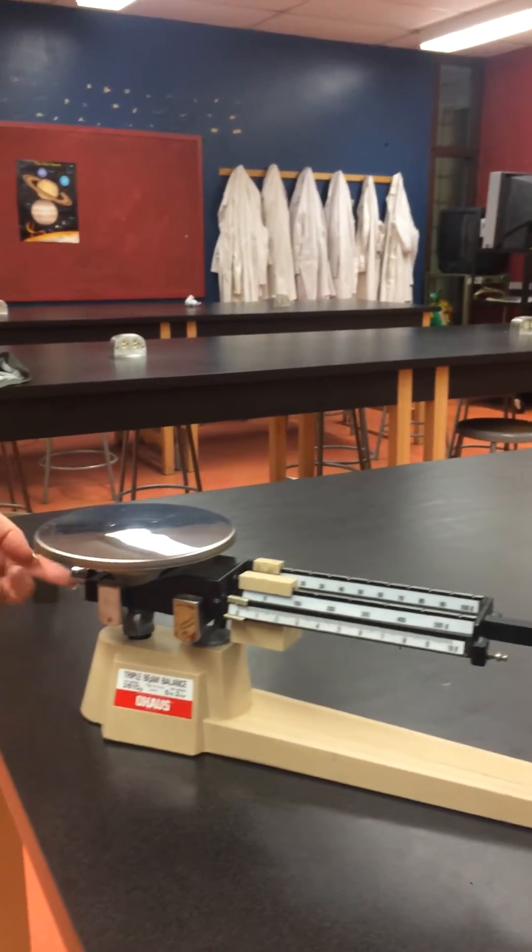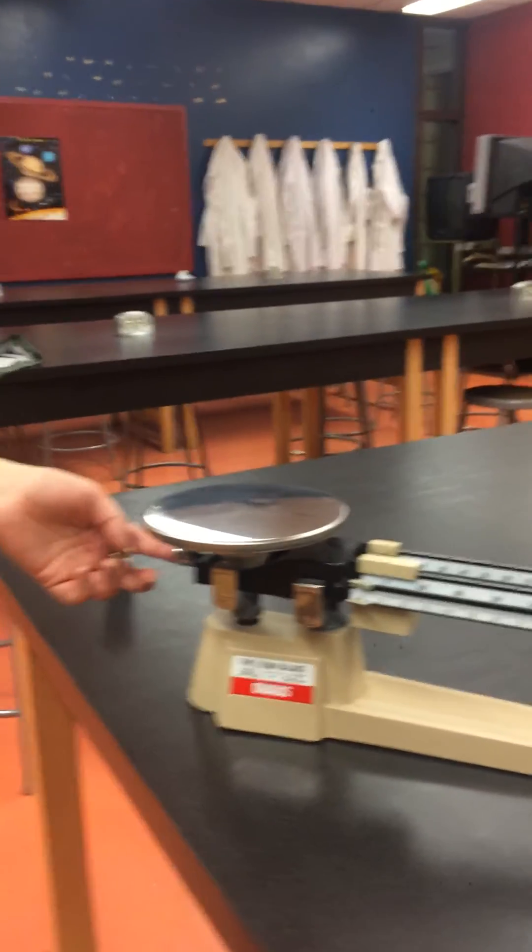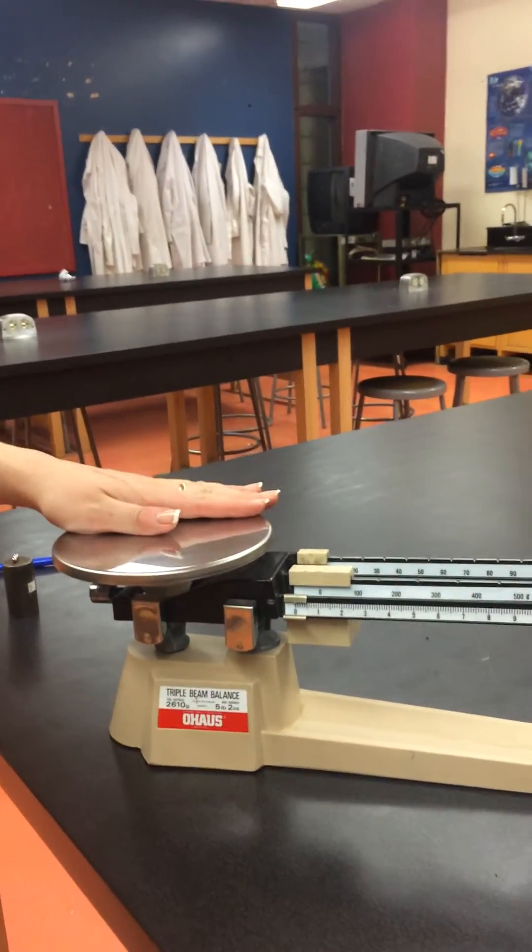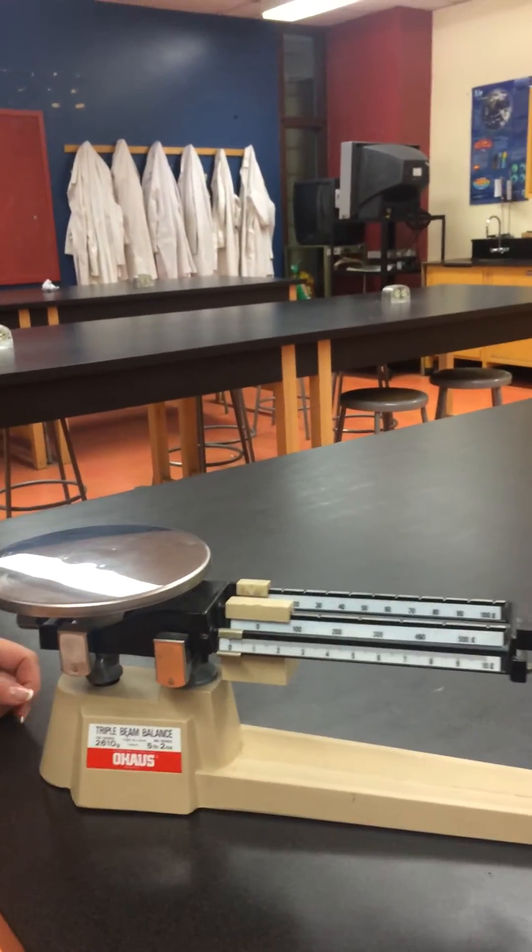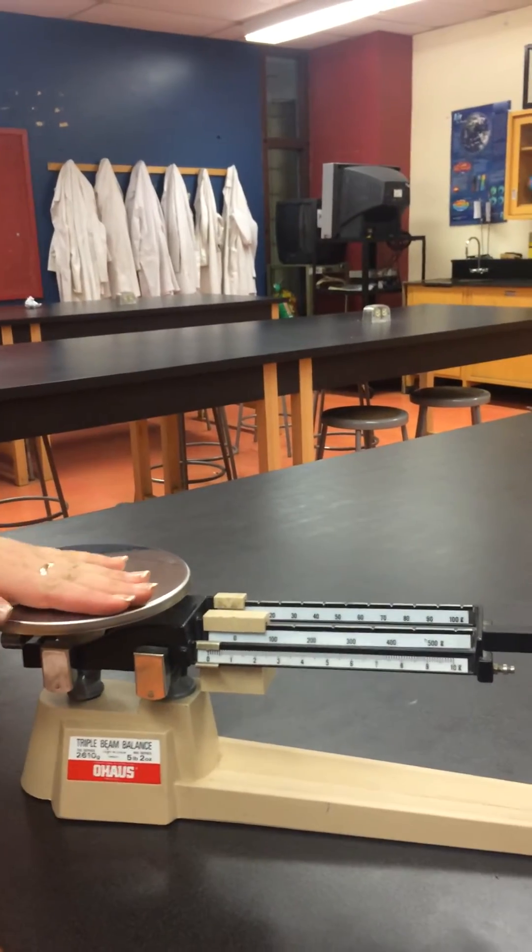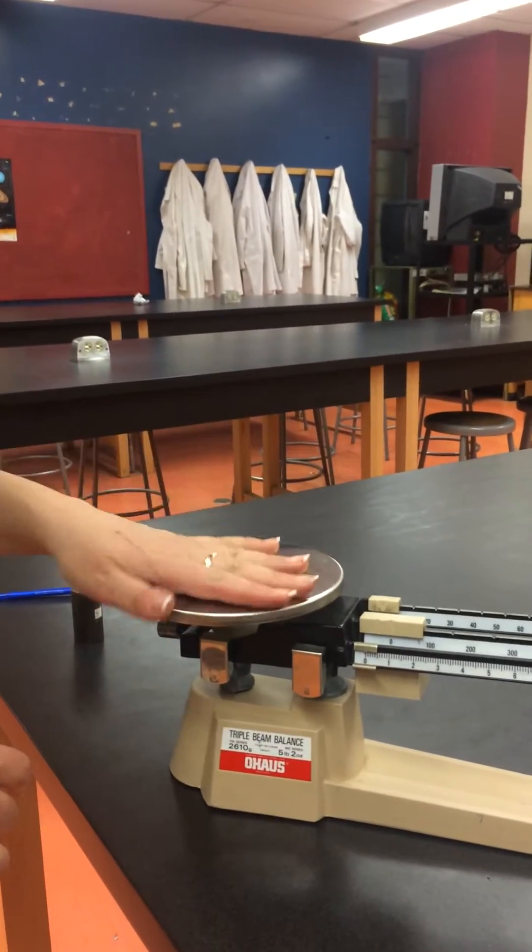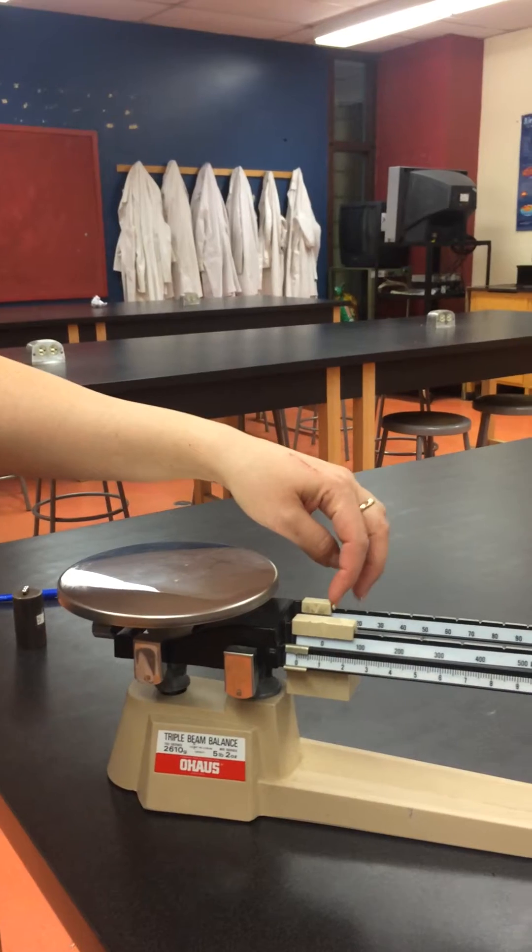And an adjustment knob here, and a pan here. You have to make sure before you start that the pan is clean, like so, and that the sliders are at zero.